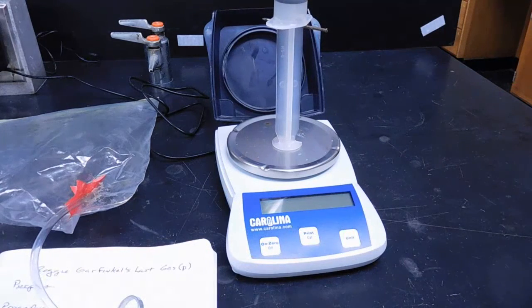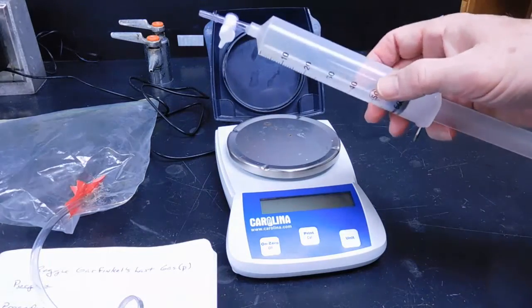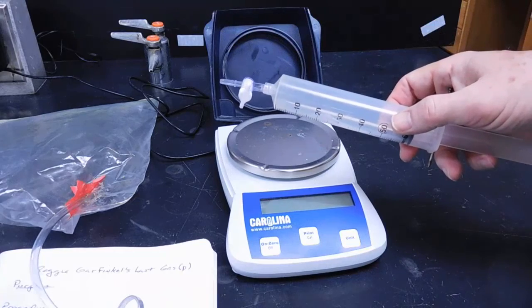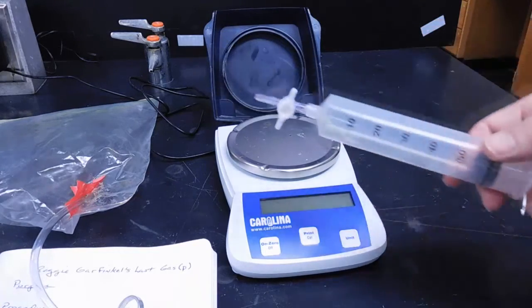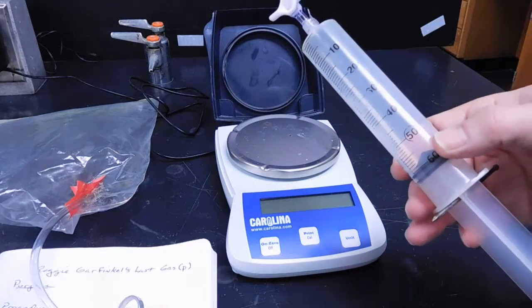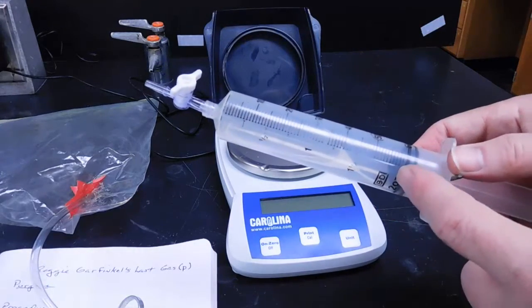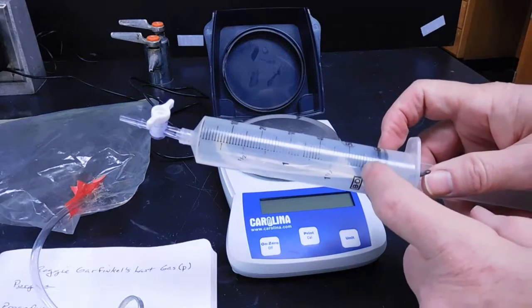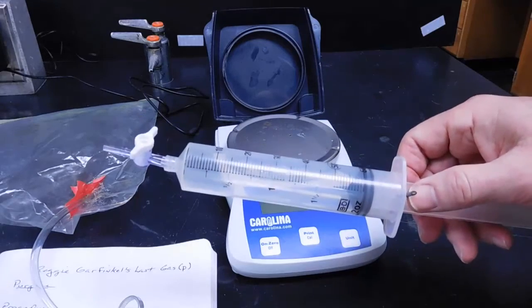Once we've done that, we're going to vent this gas either into a fume hood, if it's available, or to the outside air, so that we do not allow that gas, which is potentially hazardous to our health, in the room. And that will end the experiment, remembering that we need to record the volume of the syringe, and I usually take the volume to where that tip, the black tip, of the syringe is.